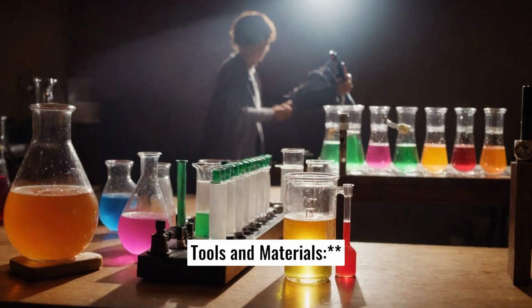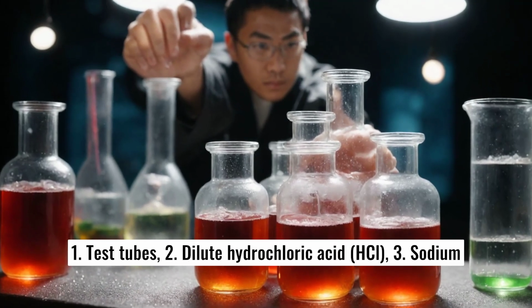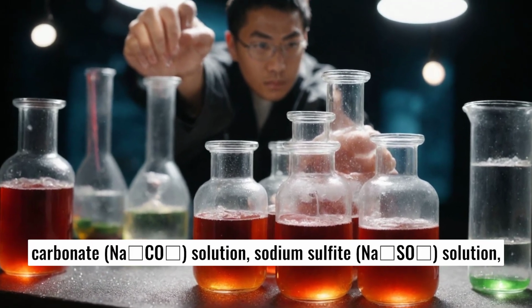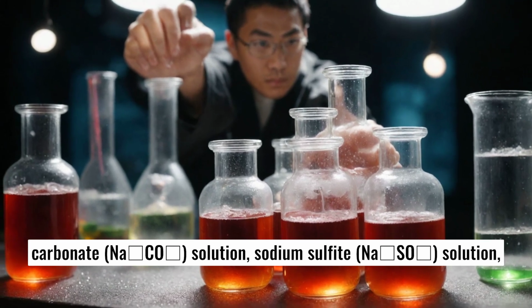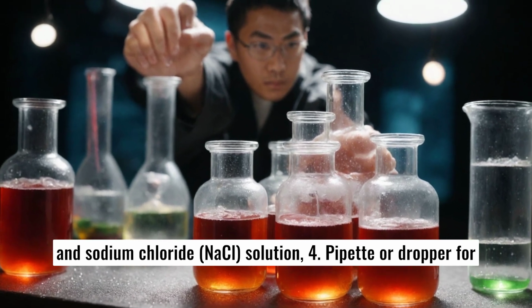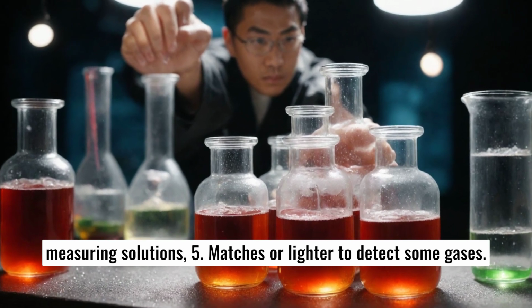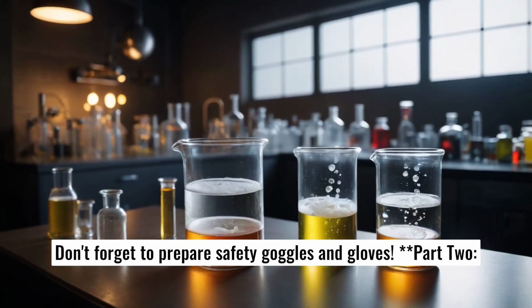Tools and Materials. 1. Test tubes. 2. Dilute hydrochloric acid, HCl. 3. Sodium carbonate Na2CO3 solution, sodium sulfite Na2SO3 solution, and sodium chloride NaCl solution. 4. Pipette or dropper for measuring solutions. 5. Matches or lighter to detect some gases. Don't forget to prepare safety goggles and gloves.